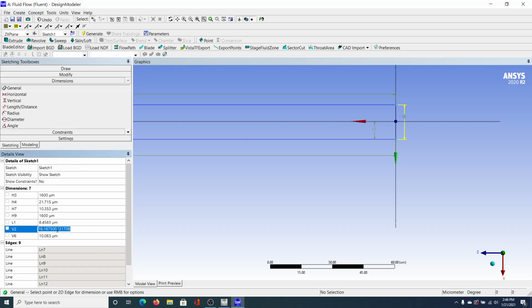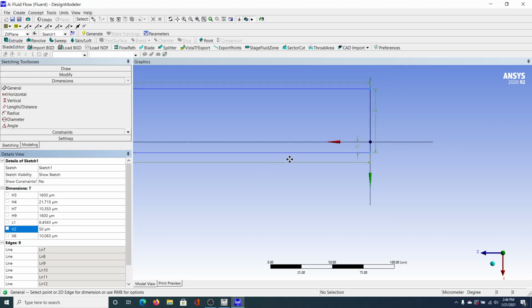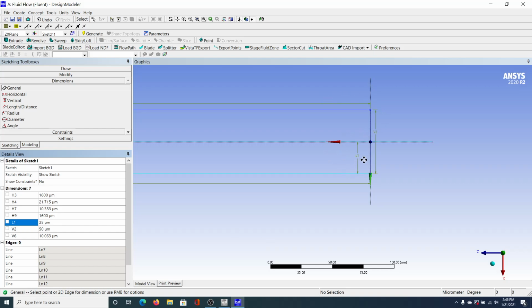And I believe the thickness was, I believe it was 50 micrometers wide, if I'm not mistaken. Let's try to see how it looks. Yeah, I think so. And then L1, since that's a symmetry, we're going to make this 25. And you can see then it's pretty much completed out, recognizing that from this point in the center to here is 25 micrometers. And that the channel width is 50.